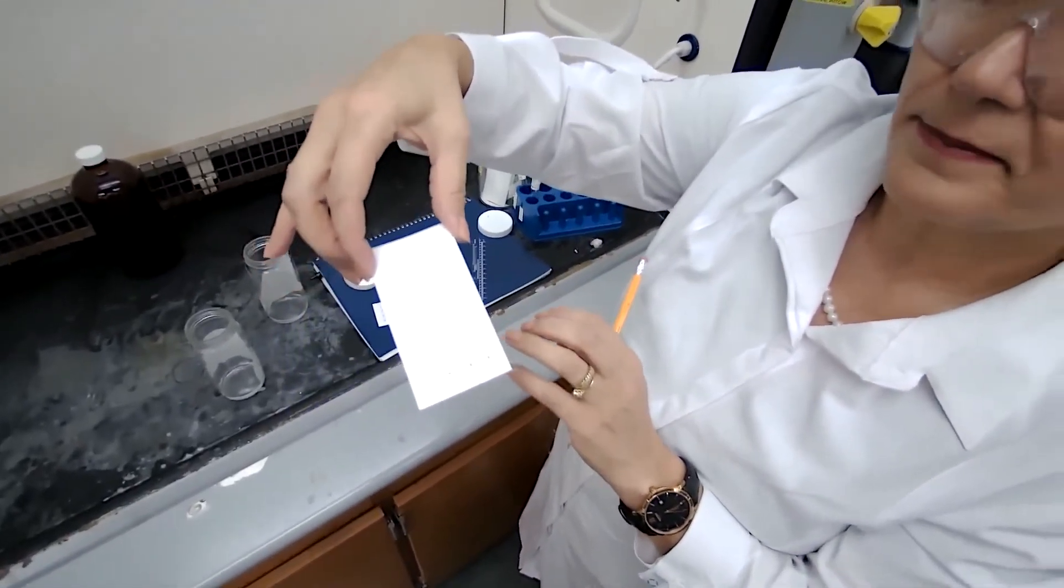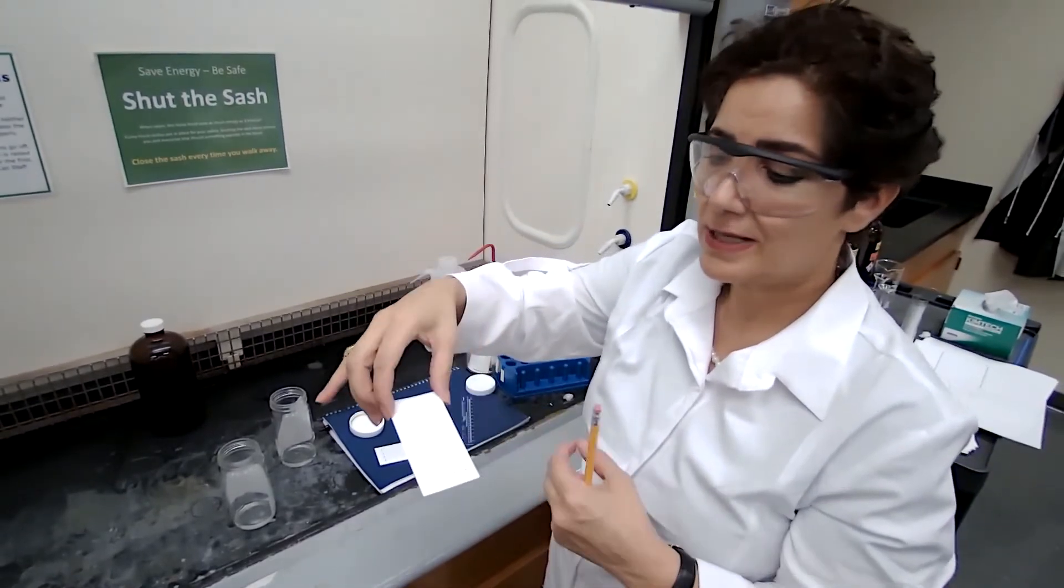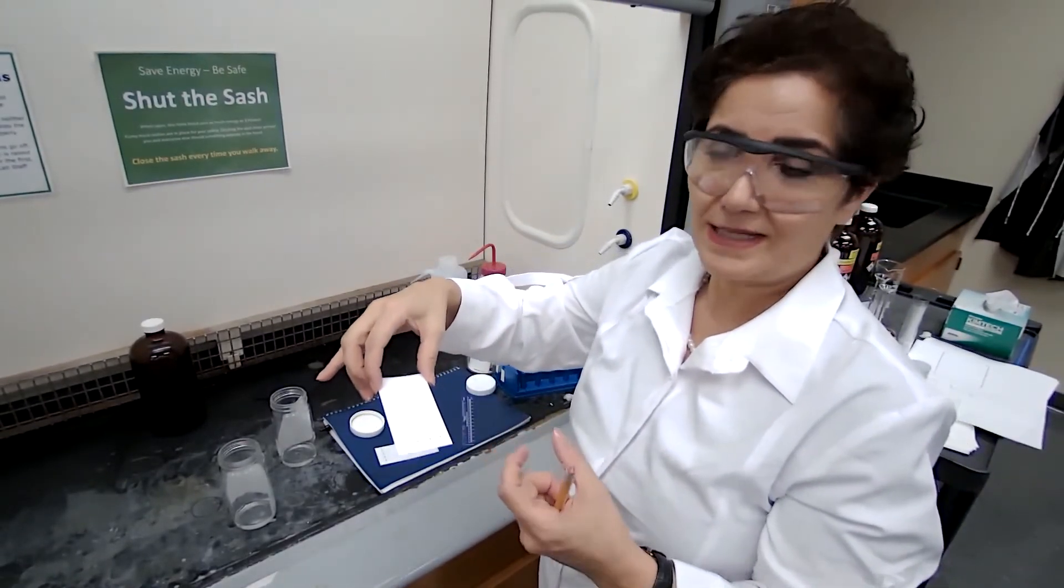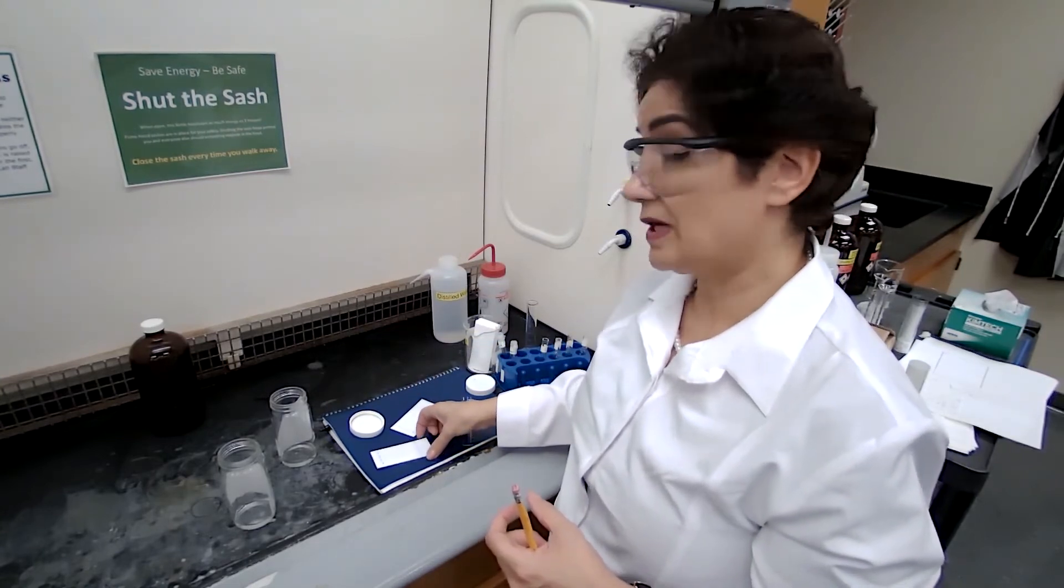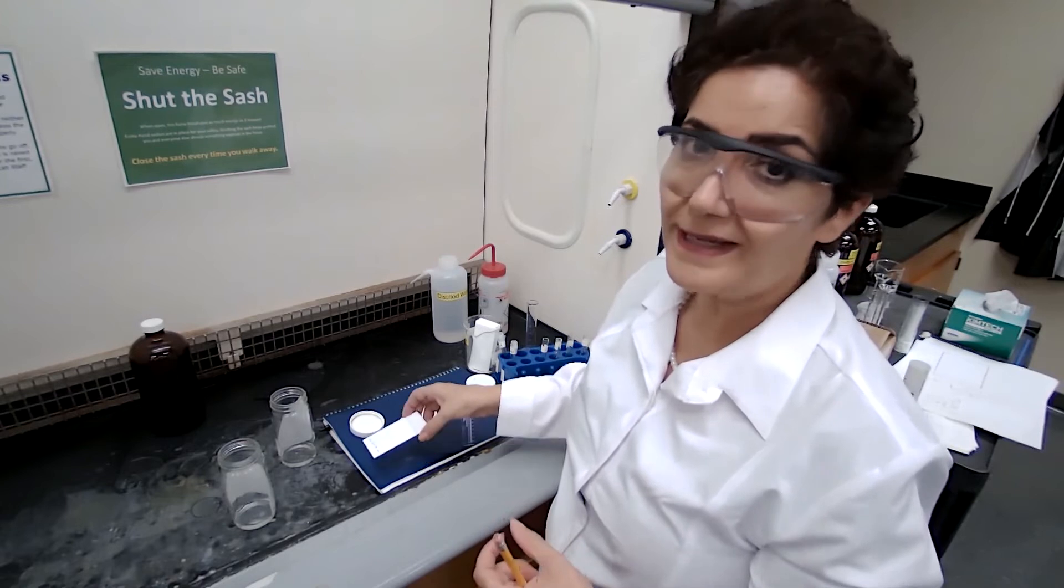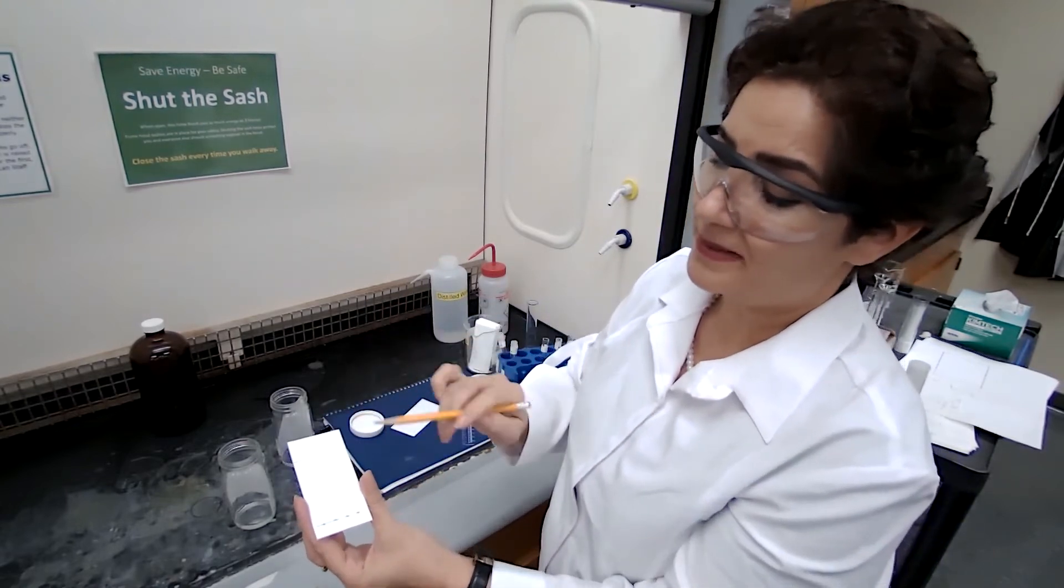So we let the solvent, the mobile phase, to dry. And the next step would be visualization. Since these compounds are visible under the UV light.